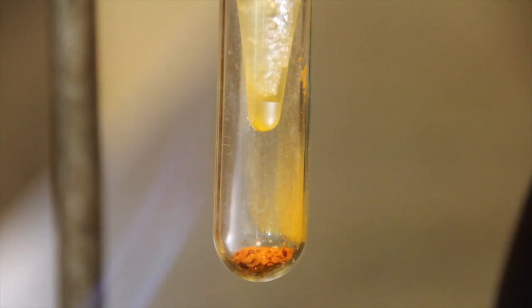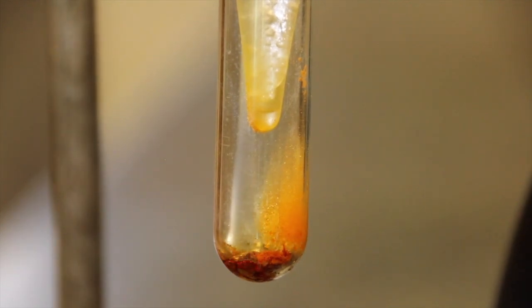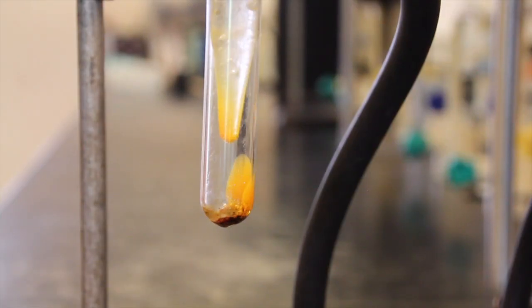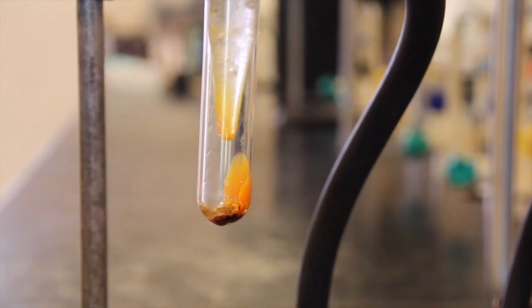Holding a microburner in your hand, gently apply heat to the bottom and sides of the sidearm test tube causing the ferrocene to sublime. As it sublimes, the purified product will collect on the cold finger provided by the ice-filled centrifuge tube. Continue to heat until all of the ferrocene has sublimed. If the solid starts to melt, remove the heat briefly and then resume heating again.